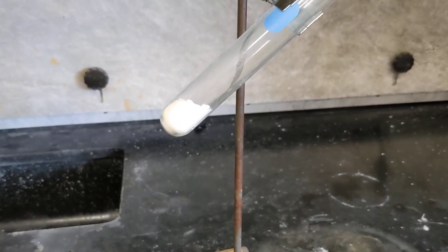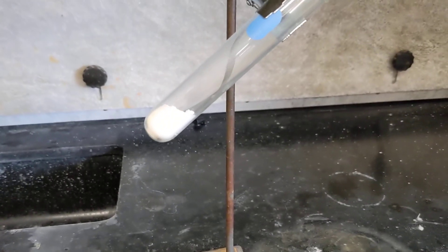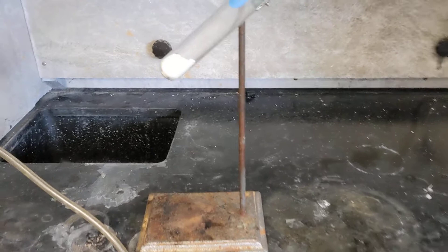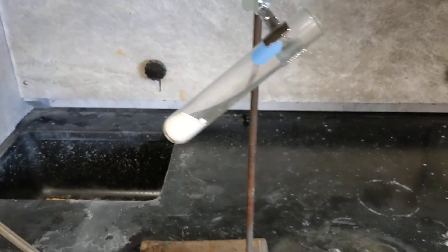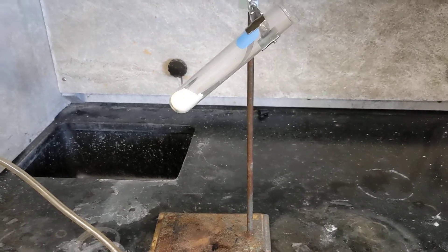I wanted to, many of you guys have seen this, but I wanted to show you it, and then we'll talk about the stoichiometry involved. So there's potassium chlorate. Potassium chlorate's an ionic salt, and I'm going to melt it, right?